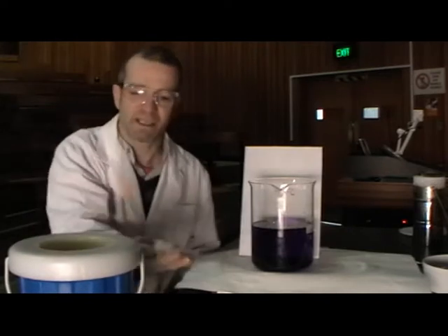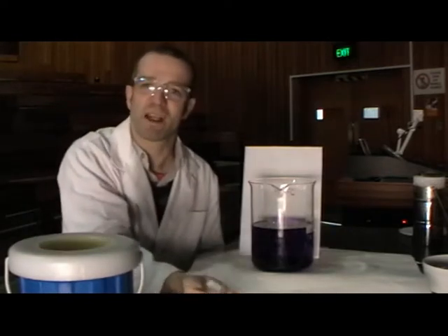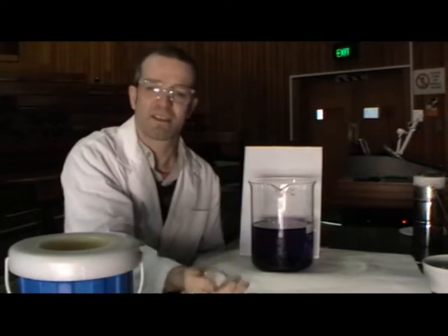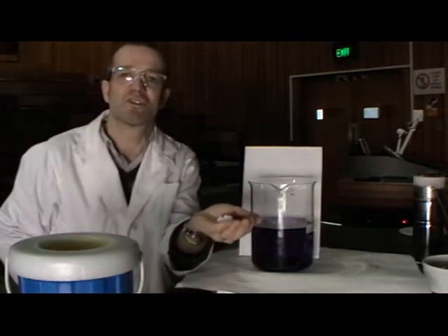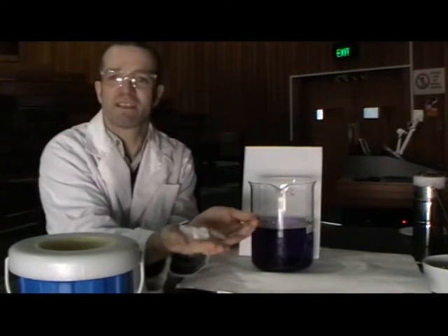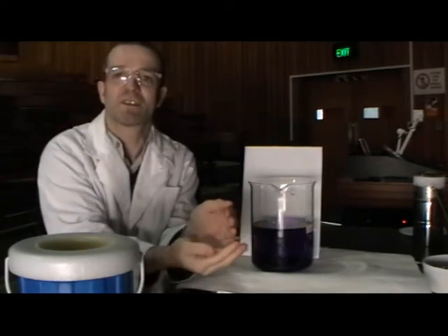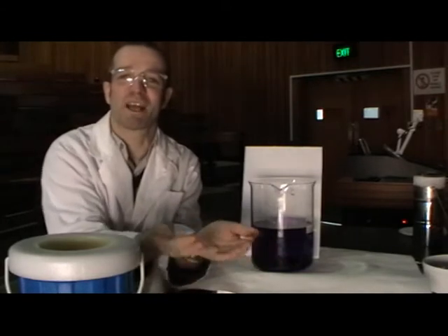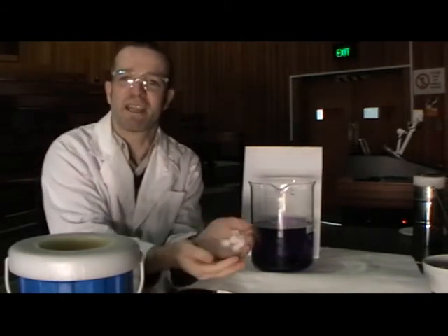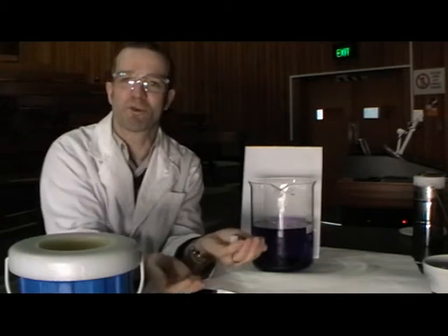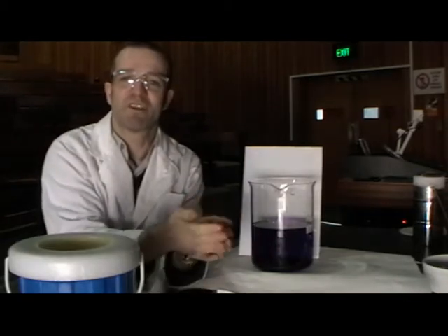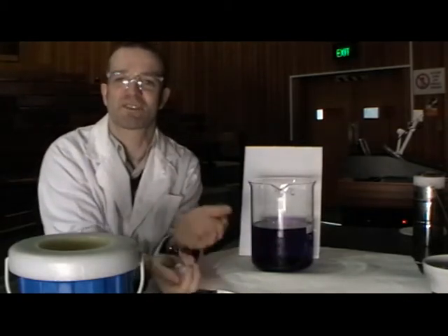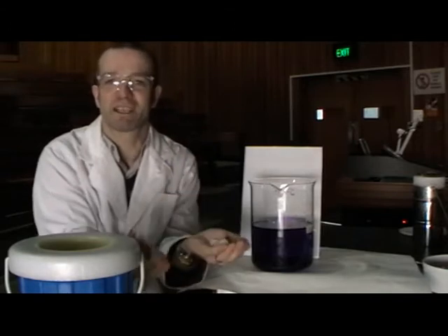At minus 80, this is the gas that we breathe out but in solid form. Solid carbon dioxide, dry ice. Dry ice is at minus 80 and it doesn't actually melt. If I hold it in my hands it will burn me, which is why I'm tossing it from one hand to the other. In the temperature of the room today, about 25 degrees, this will convert straight from the solid into the gas. It will sublime.